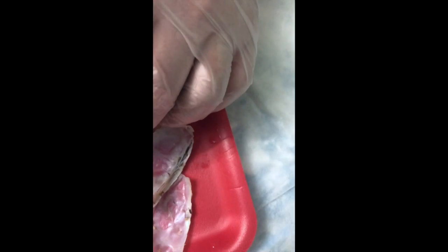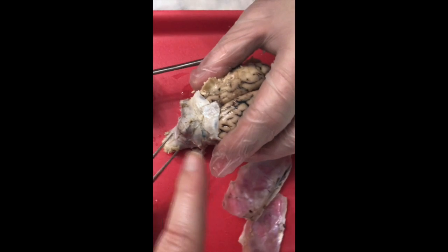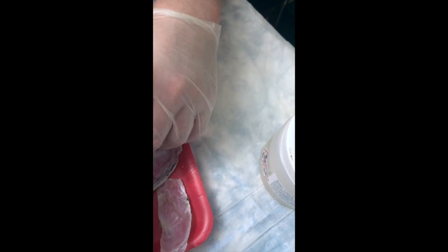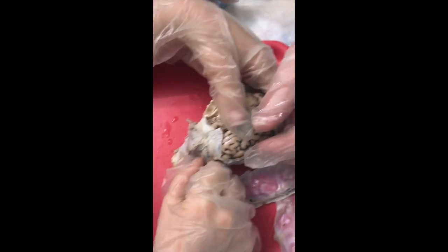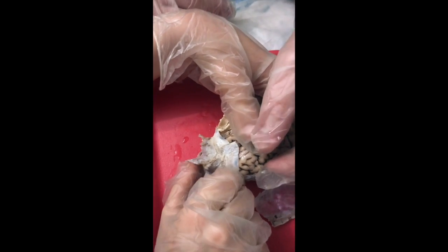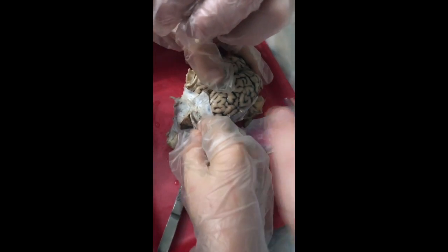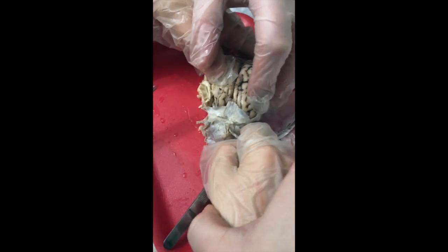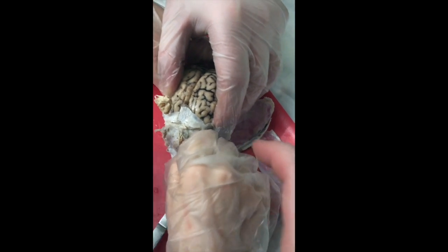So what you need to do is have one person grab the brain in two hands. Two hands. Nope, hold on. One hand over here. Sorry, trying to direct my son here. And one hand on this end. Hold on. I want him to bend this in half. Sorry, no, hold the brain, hold the whole thing, not just that, guys.